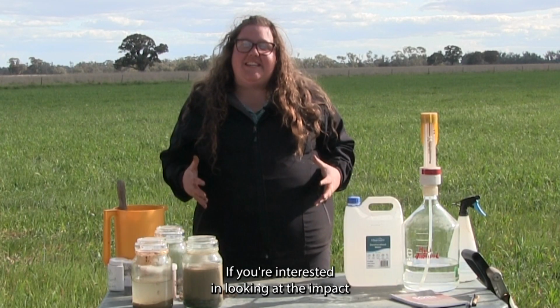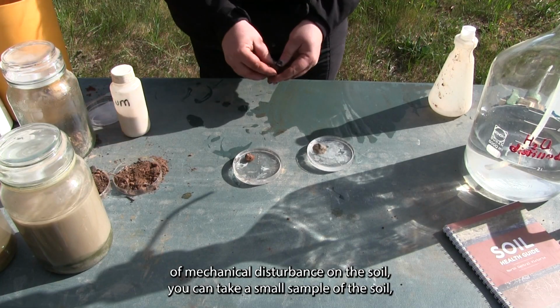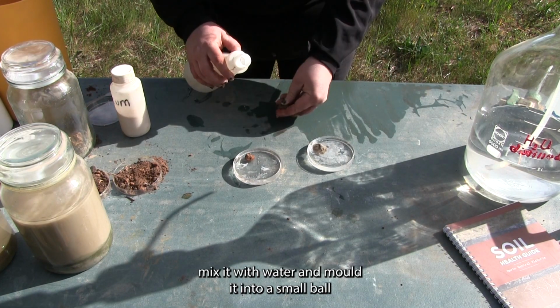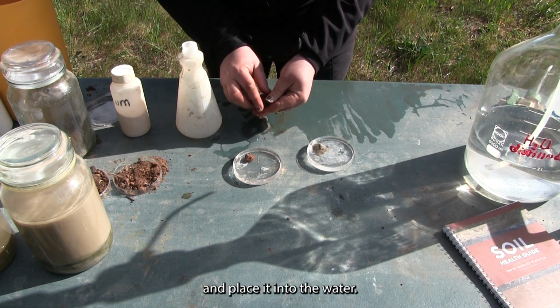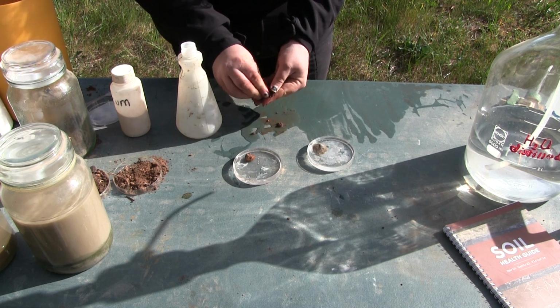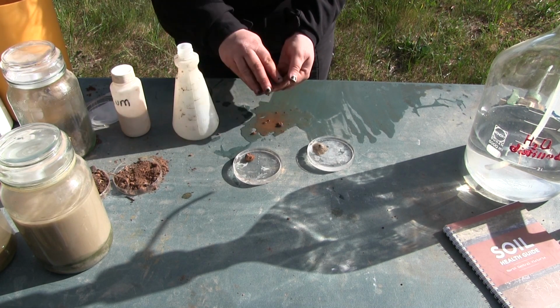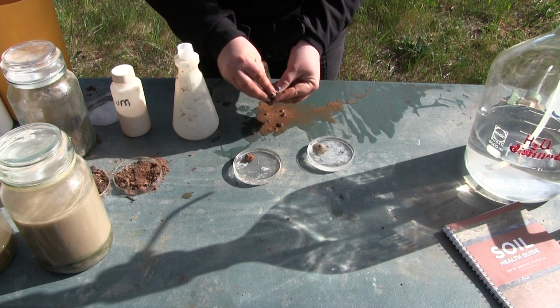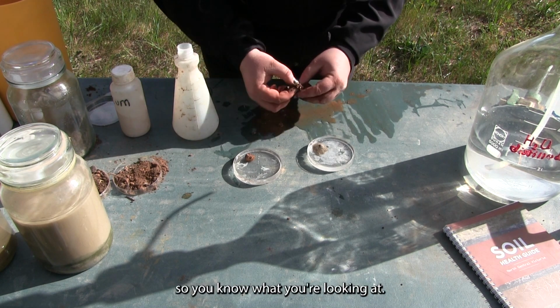If you're interested in looking at the impact of mechanical disturbance on the soil, you can take a small sample of the soil, mix it with water, and mould it into a small ball and place it into the water. Make sure to label the samples so you know what you're looking at.